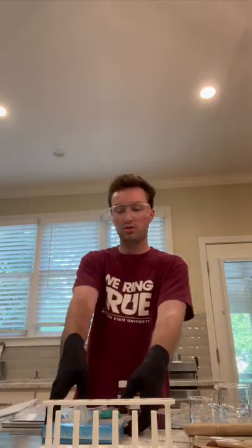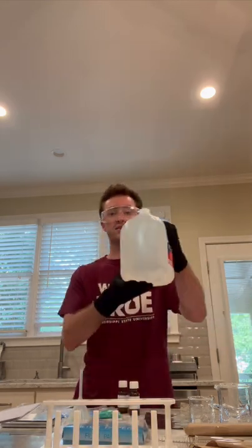I also have various test tubes, you can see right here, in a test tube rack that I'll be using once I prepare my chemicals. I will be labeling the test tubes and storing them properly on my test tube rack. I also have various beaker sizes to help measure out my liquid chemicals. I also have filter paper and my distilled water. So without further ado, let's get started.